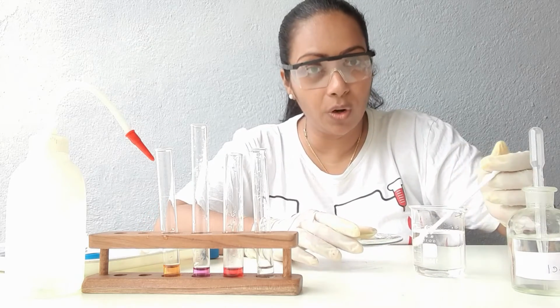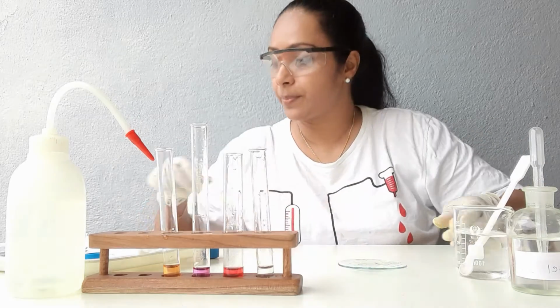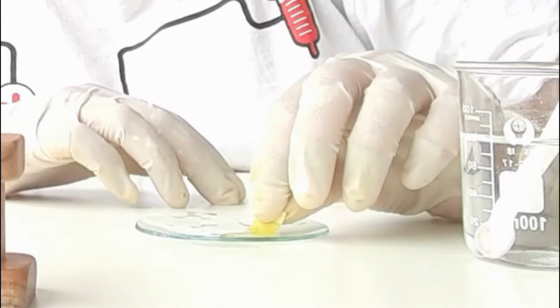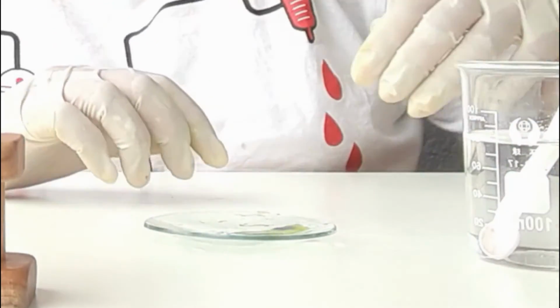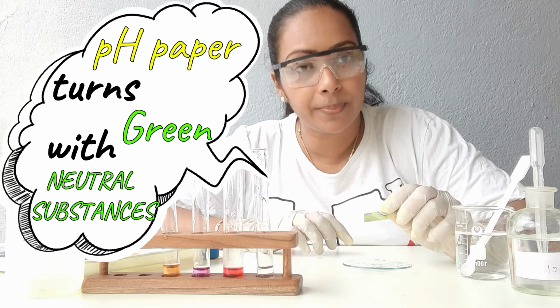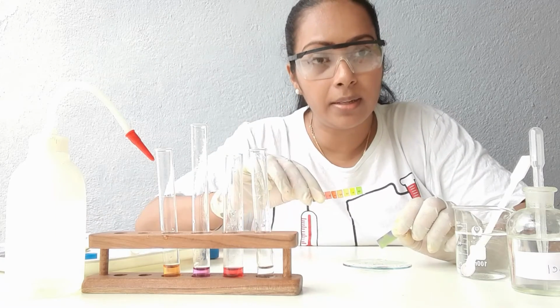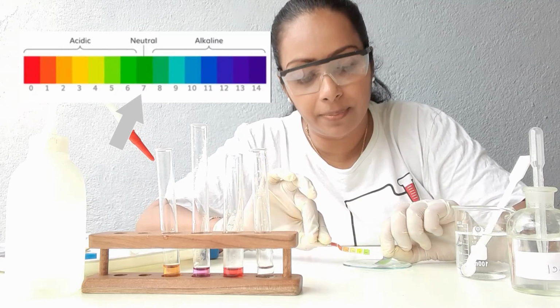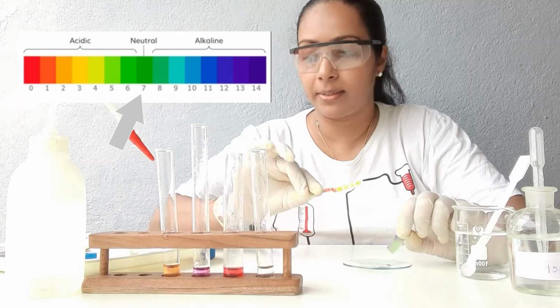Let's check a sample of salt water, a neutral substance, with pH papers. It turns into a green color. If you compare with the pH scale, the green color stands somewhere between 6 and 7, which represents a neutral substance.